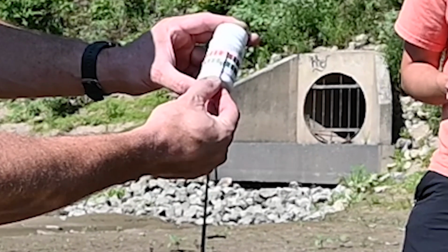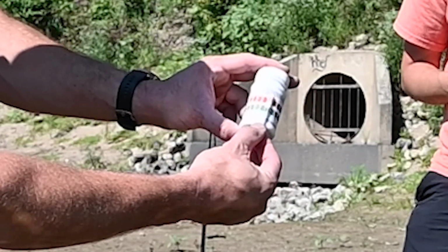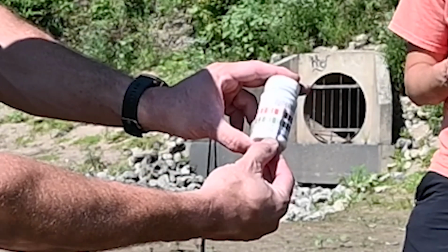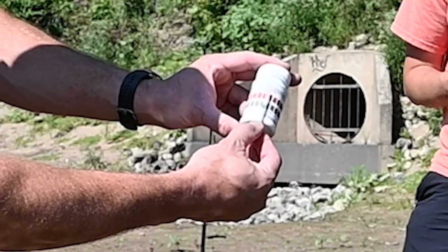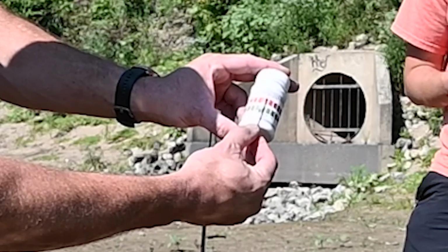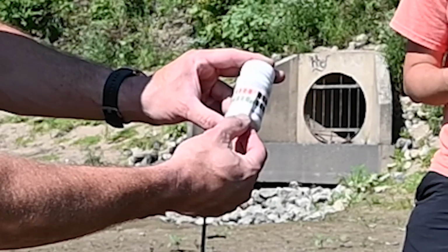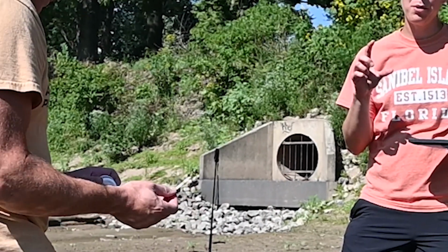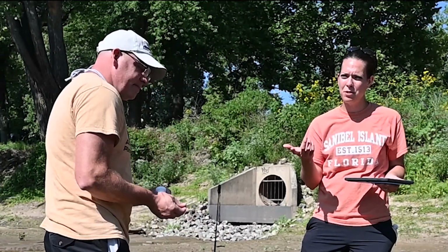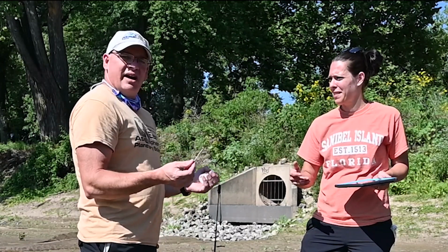Now, this isn't going to be quite as precise as the other one. But on this one, as hopefully we see in the picture, we can see it's not quite dark enough at the top to be 8.5, but it's a little darker than at 8. So somewhere between 8 and 8.5 is what we got. And that's really good because what we received on our probe when we took the pH reading with the Vernier sensor was 8.2. So I agree with between 8 and 8.5. Yeah, I think that makes a lot of sense.